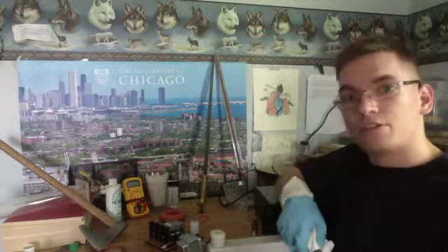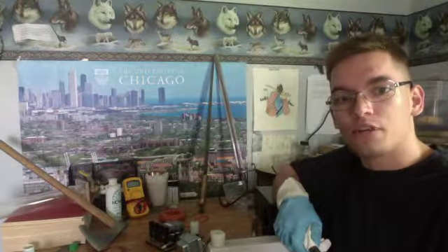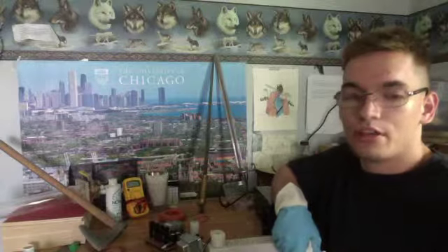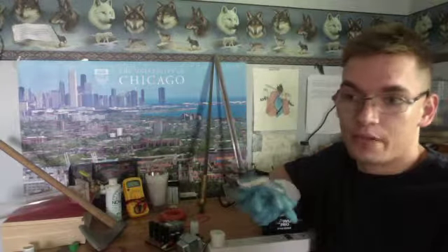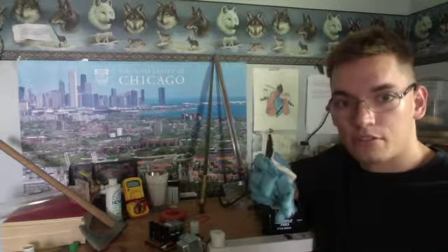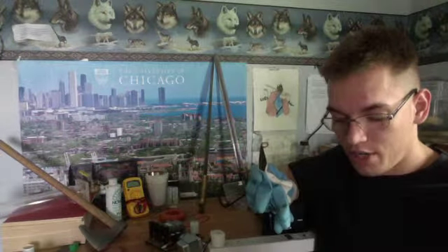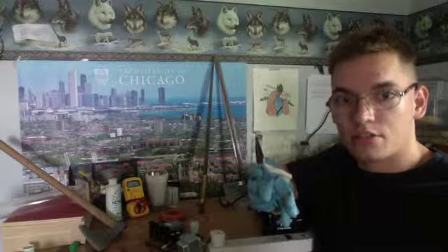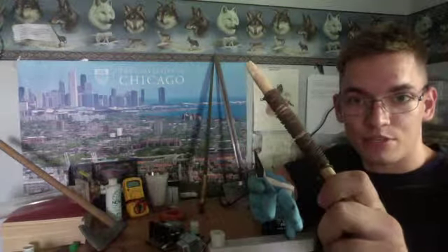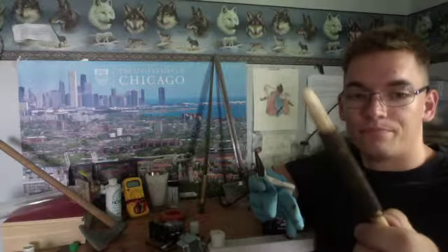The final reaction we are going to be going over today involves oxidation. Now, oxidization, as you may know, is where oxygen bonds with various other materials. In this case, we're going to be analyzing copper, which I have in these pliers here. Common forms of oxidization often include things such as rust, which you can see wrapped around this piece of wood on these chunks of iron.